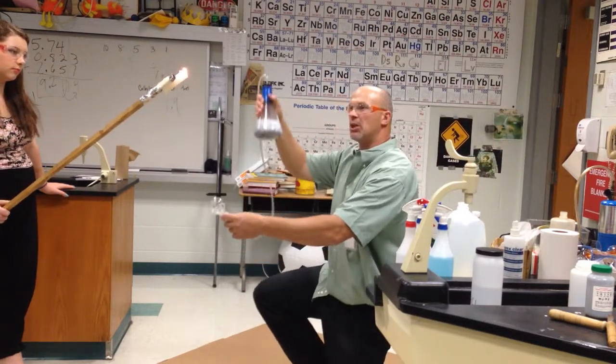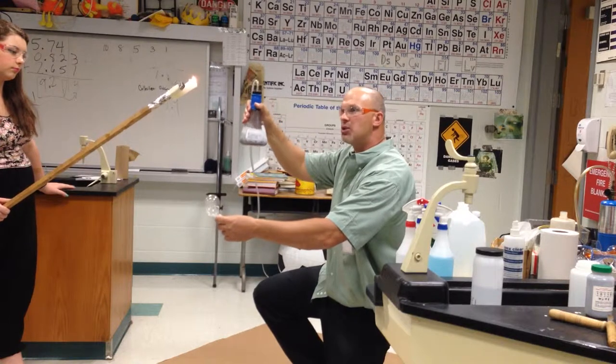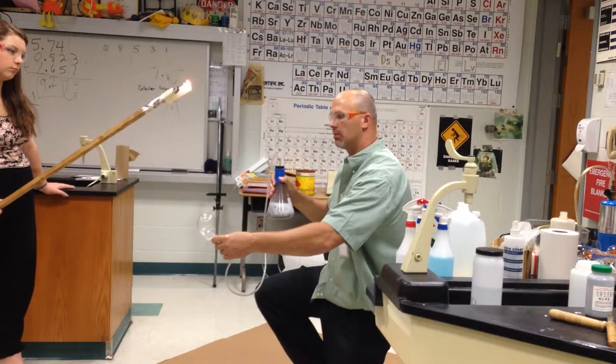Chemical change or physical change? I'm making H2 gas from zinc. Chemical.